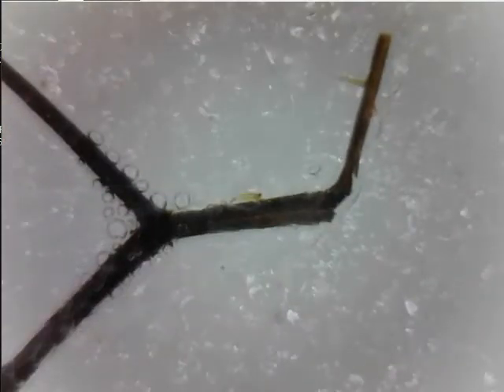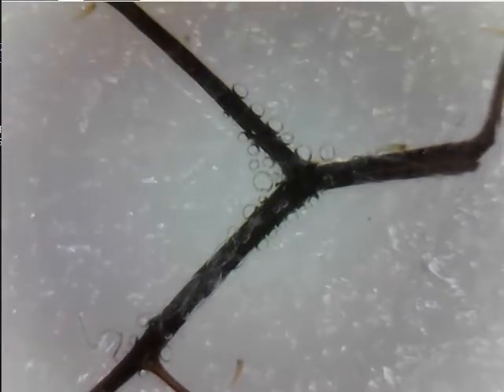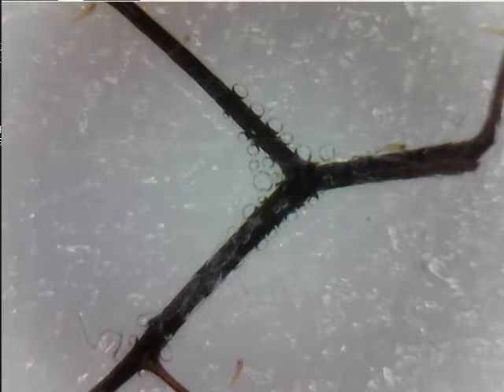I am pressed down on the thing, and I wasn't sure if I did anything. Okay, it does kind of look like I did something. But, I'm guessing this is about somewhere closer to the base of the wing, considering how it gets thicker right here. If you think with a wing, it wants to become thinner as it goes out. Because, the farther away it is from the start, the less it has to hold, the less it is beyond it, and the less the weight it's attached to.